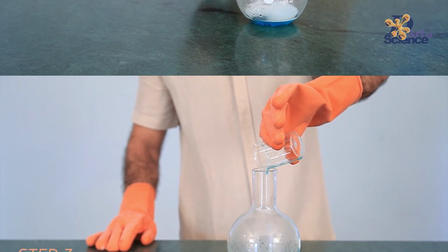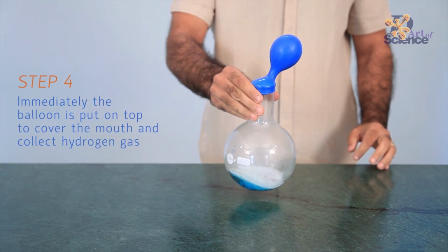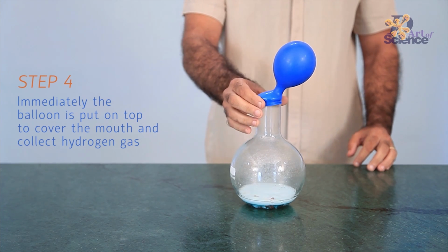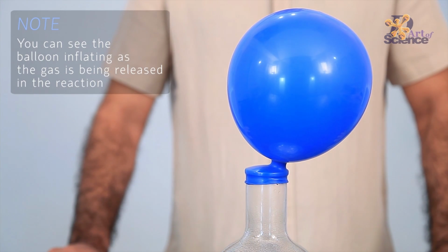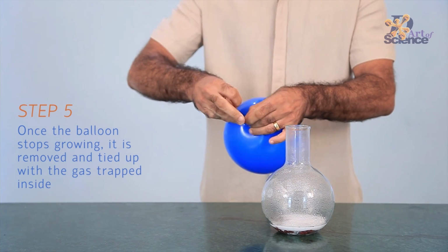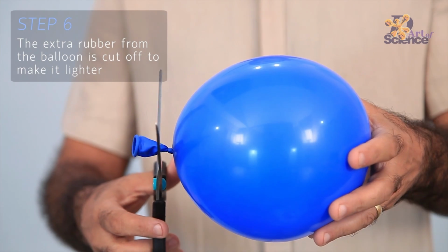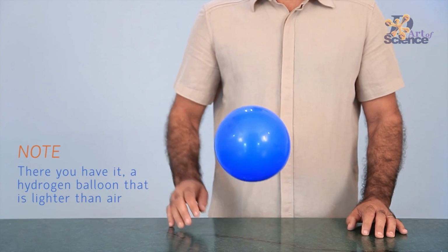In this experiment, the reaction between zinc granules and sulfuric acid leads to the evolution of hydrogen gas, which is trapped by the balloon, leading to its inflation. Now, since hydrogen is the lightest element, its density is less than that of air, and so the balloon can float in air. How cool, right?